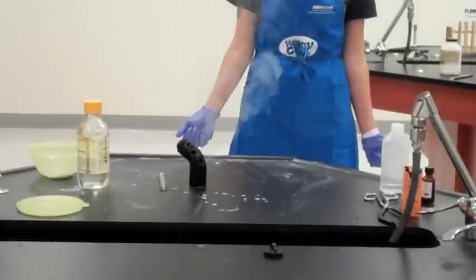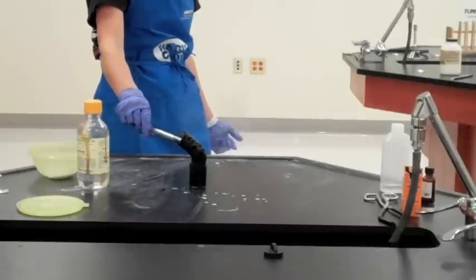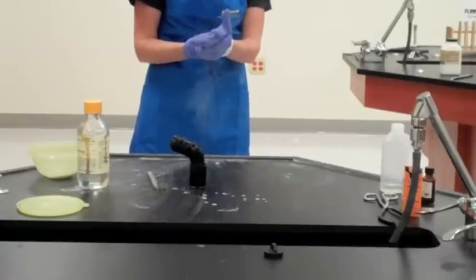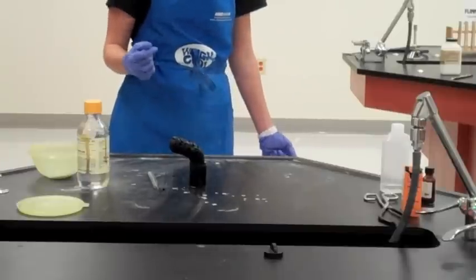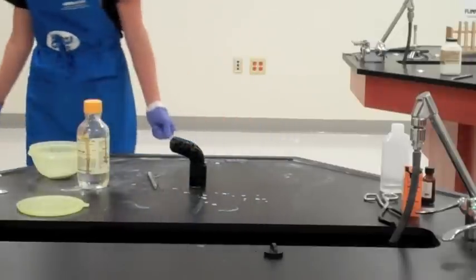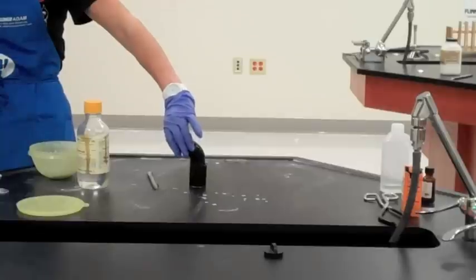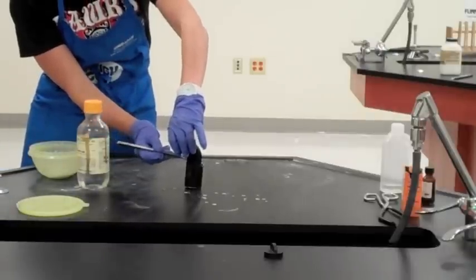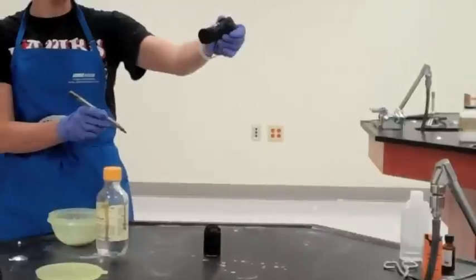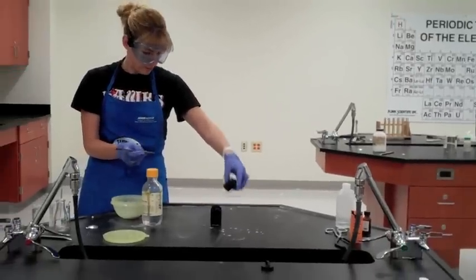Although sometimes I just think it looks like a really big turd. The vapor coming off is the same water vapor as before, and what we have left over — our little sugar snake — is just pure carbon. This is a very exothermic reaction, but it's cooled off enough. If I can pull it out — this is a solid hunk of carbon. It's very spongy because of the water vapor, and very lightweight because of the carbon. It's like a hard sponge.